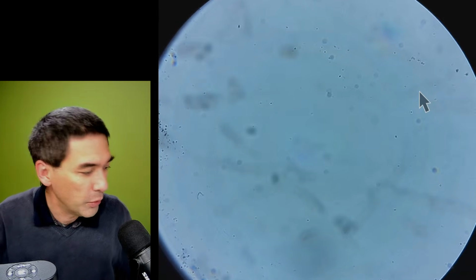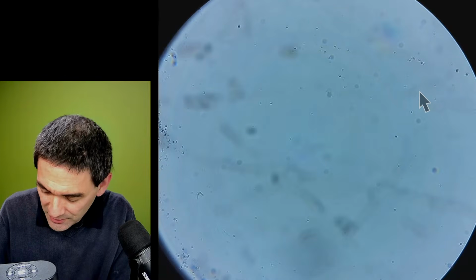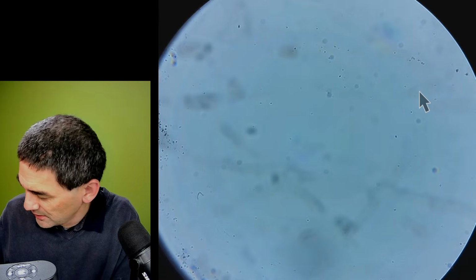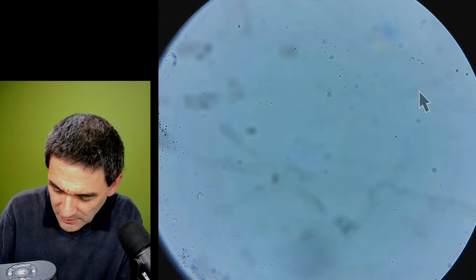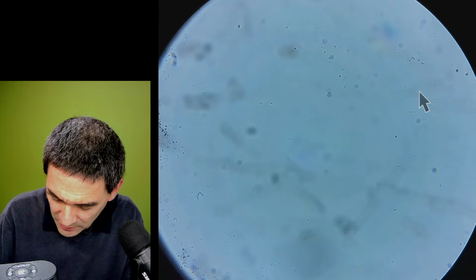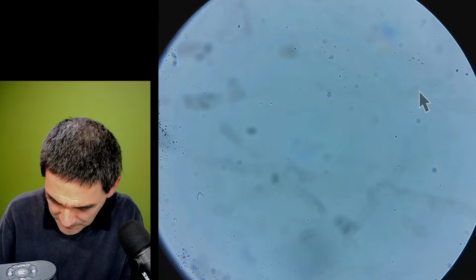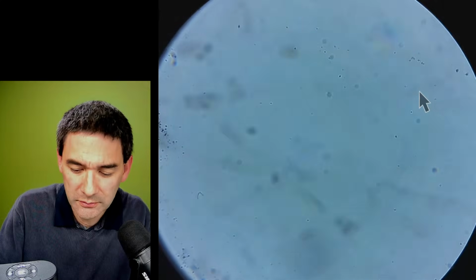Let's look at a few more, and then let's go quickly through some of the questions, hoping that I will have them answered. But this is also one, a housefly again. What is this here? I don't know what that is, and I don't see anything on here. Flower. Some kind of flower.